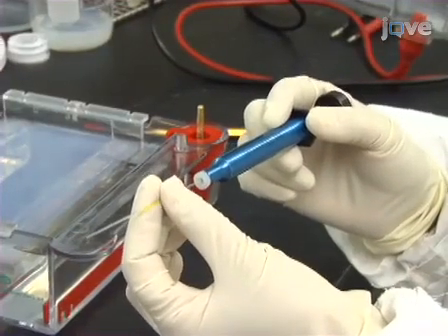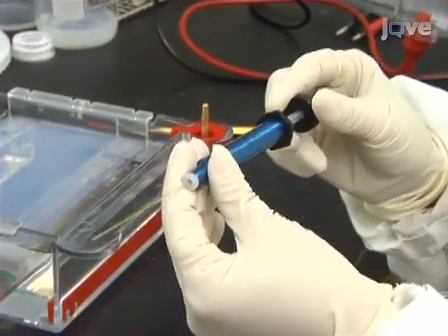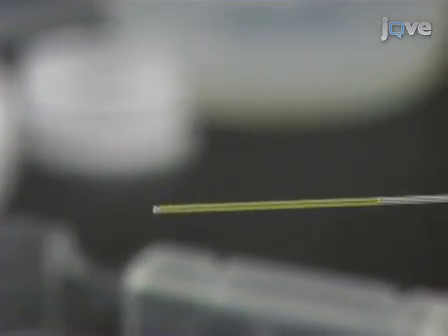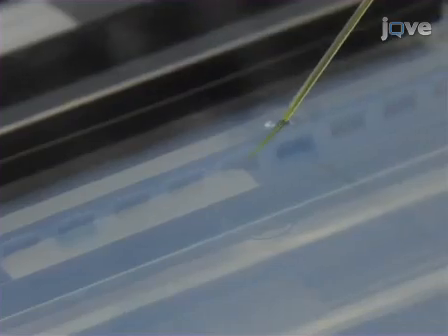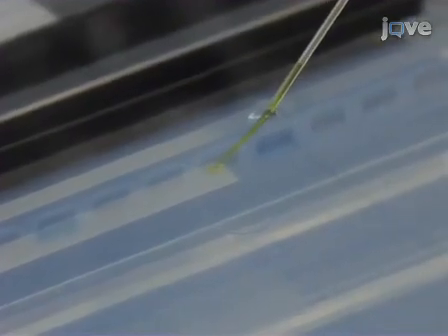Place the capillary dispenser on the end opposite to the PCR reaction mix and slowly turn the plunger clockwise until the liquid is at the very bottom of the tube. Place the capillary into the well to be loaded and slowly turn the plunger clockwise to dispense the Ficoll weighted sample into the agarose well.